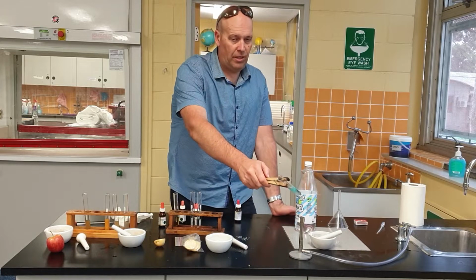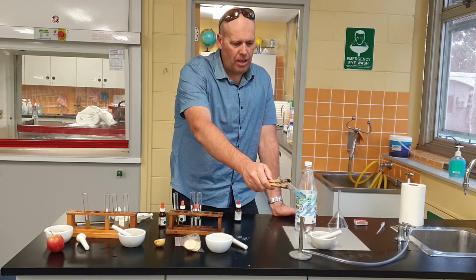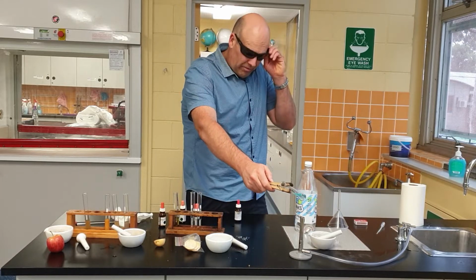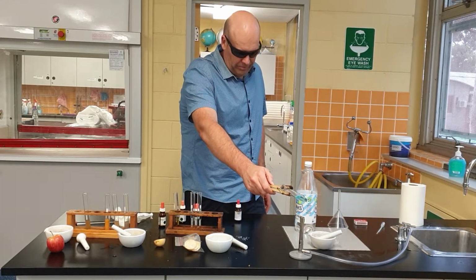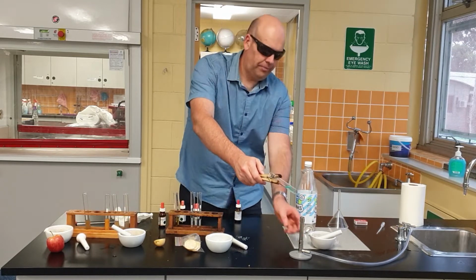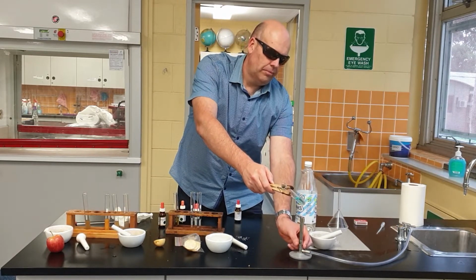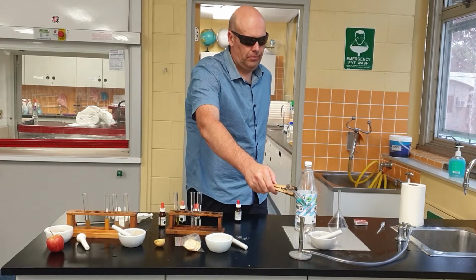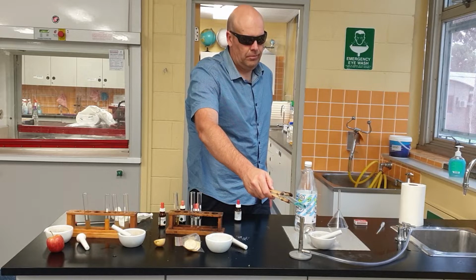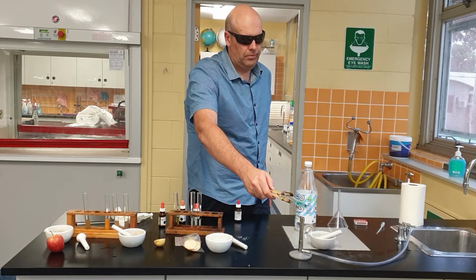So let's heat it up. This is the big test. Are they lying? Well, we're going to find out. No sugar. Better not be lying to us.